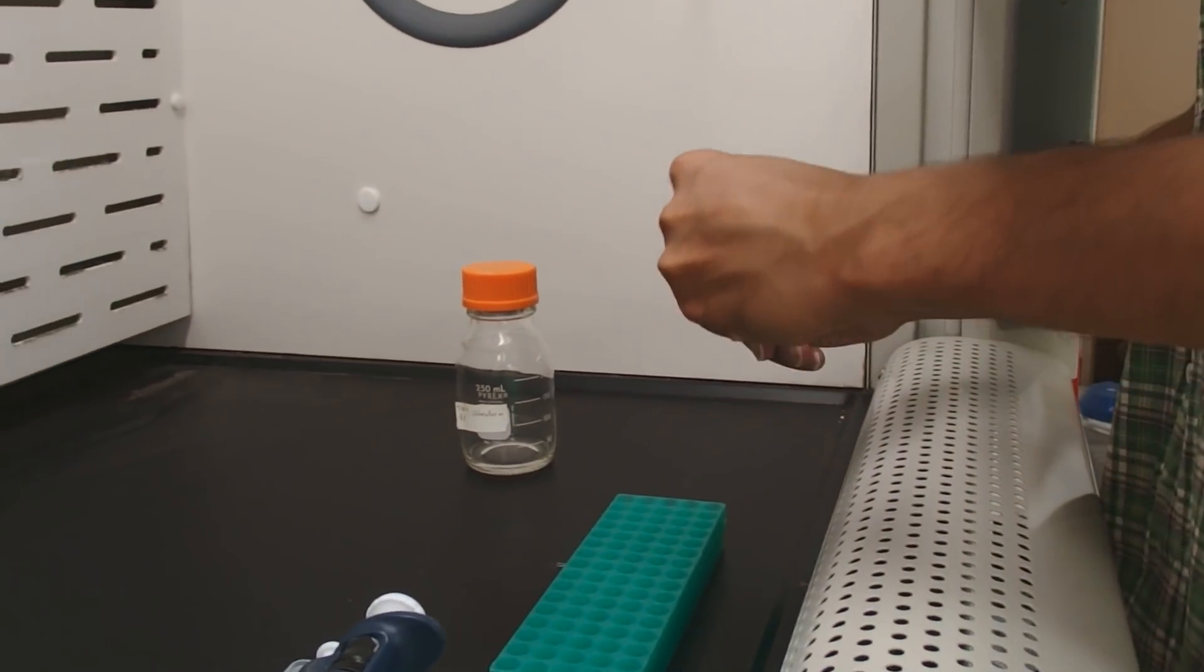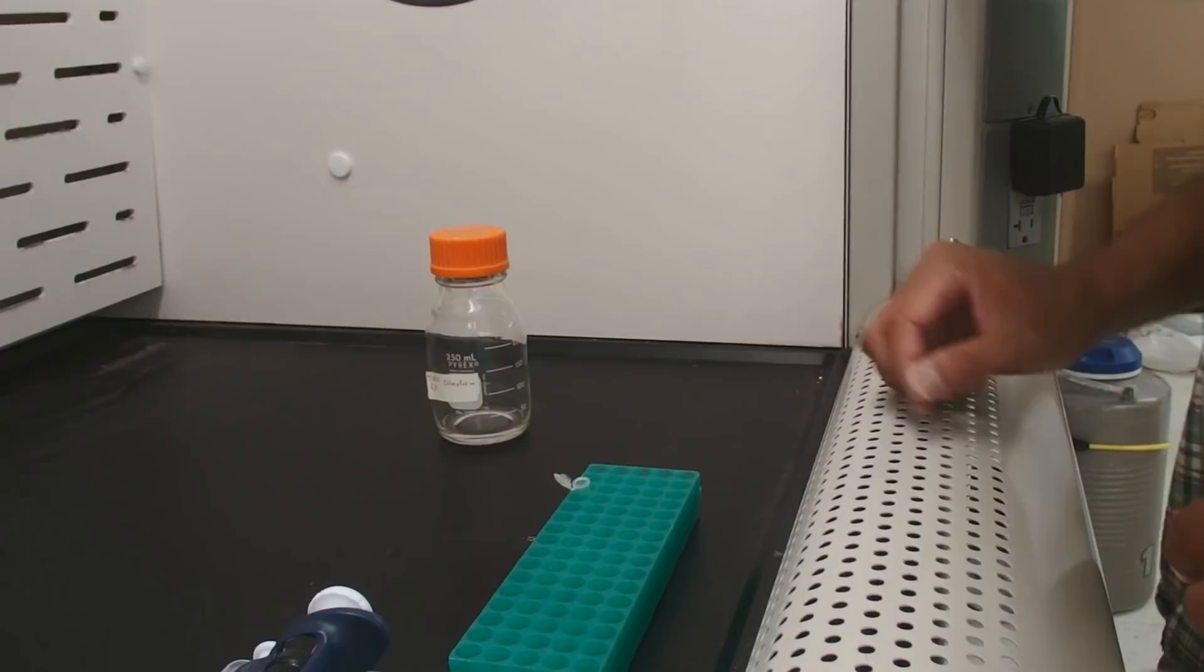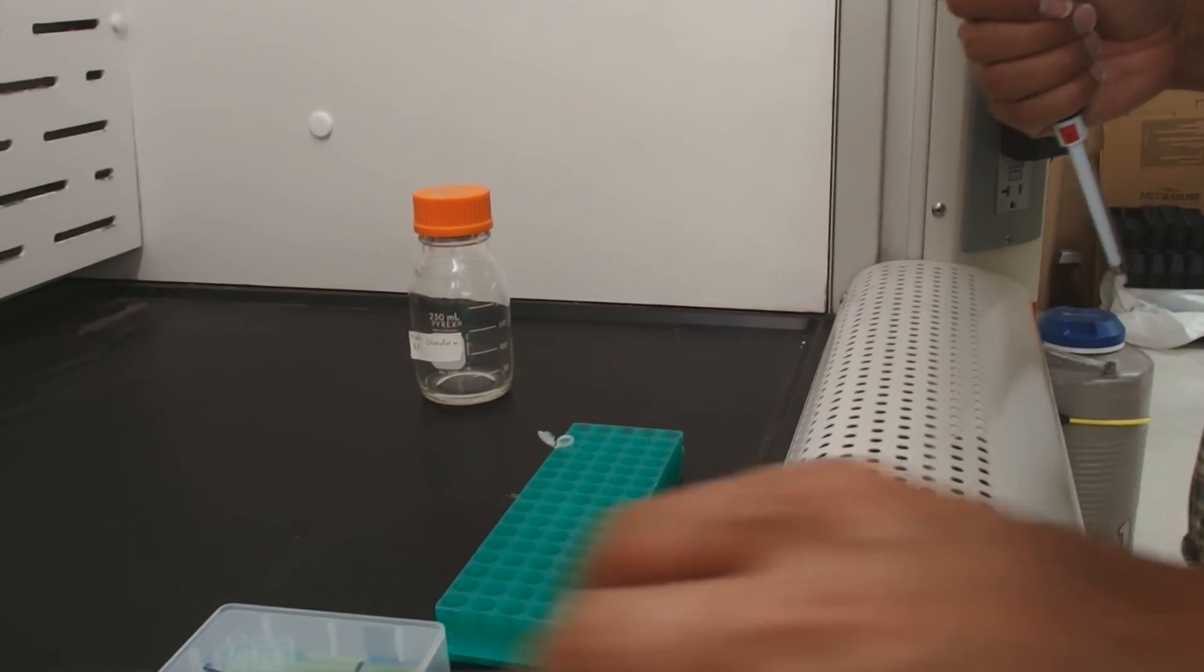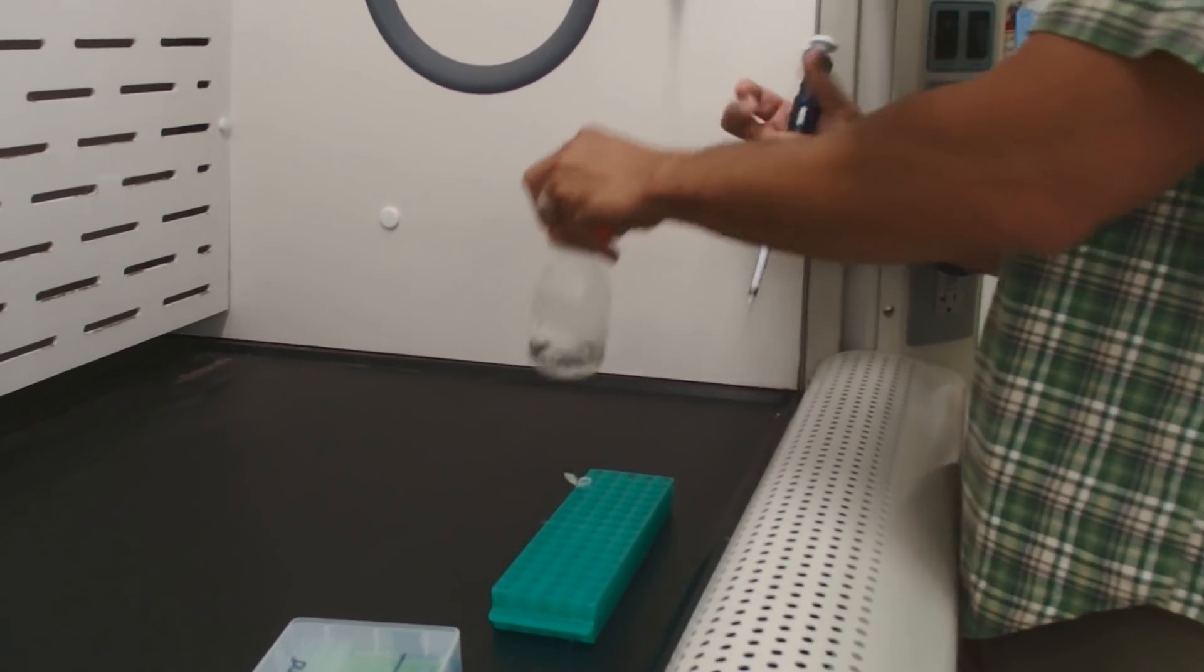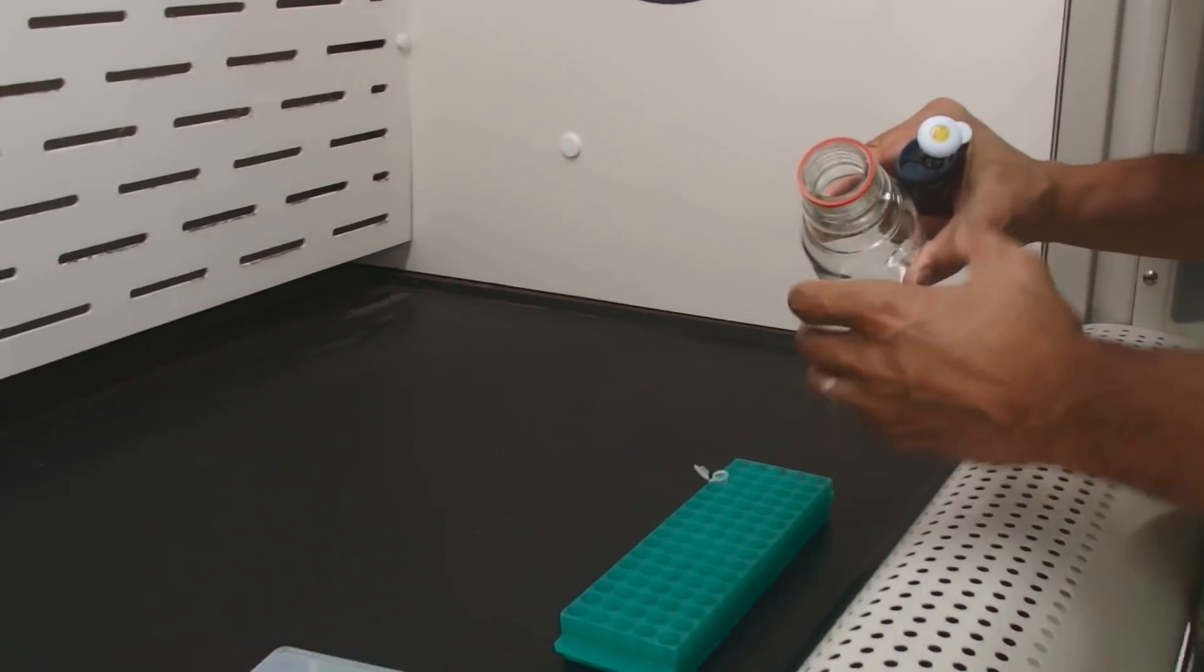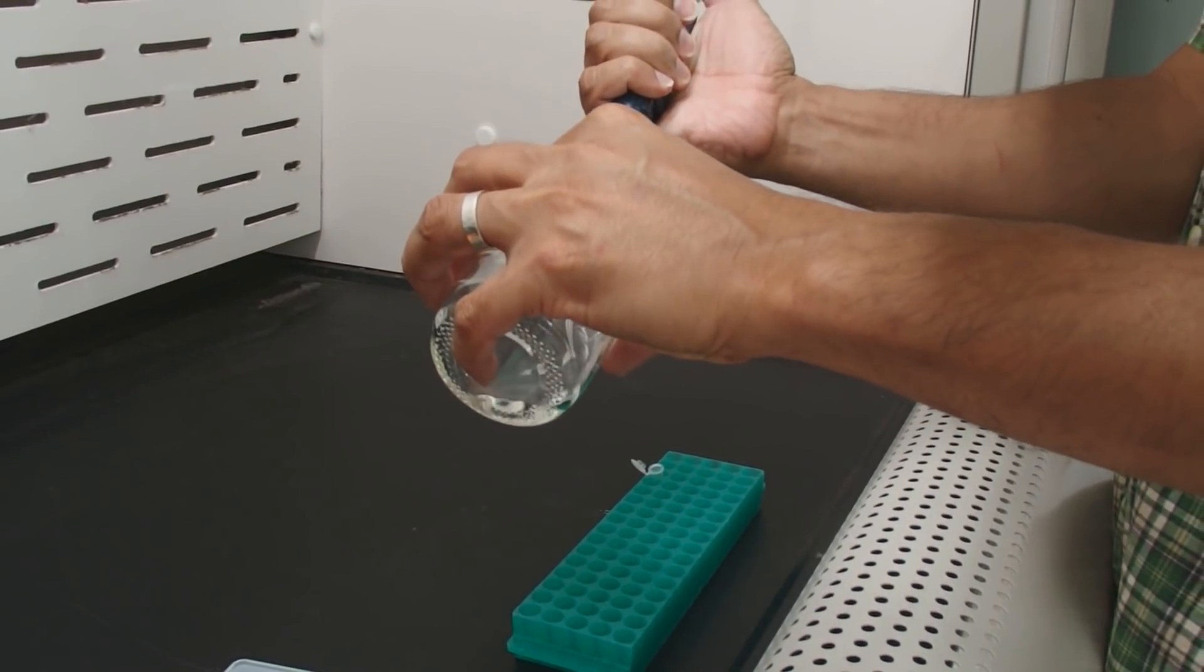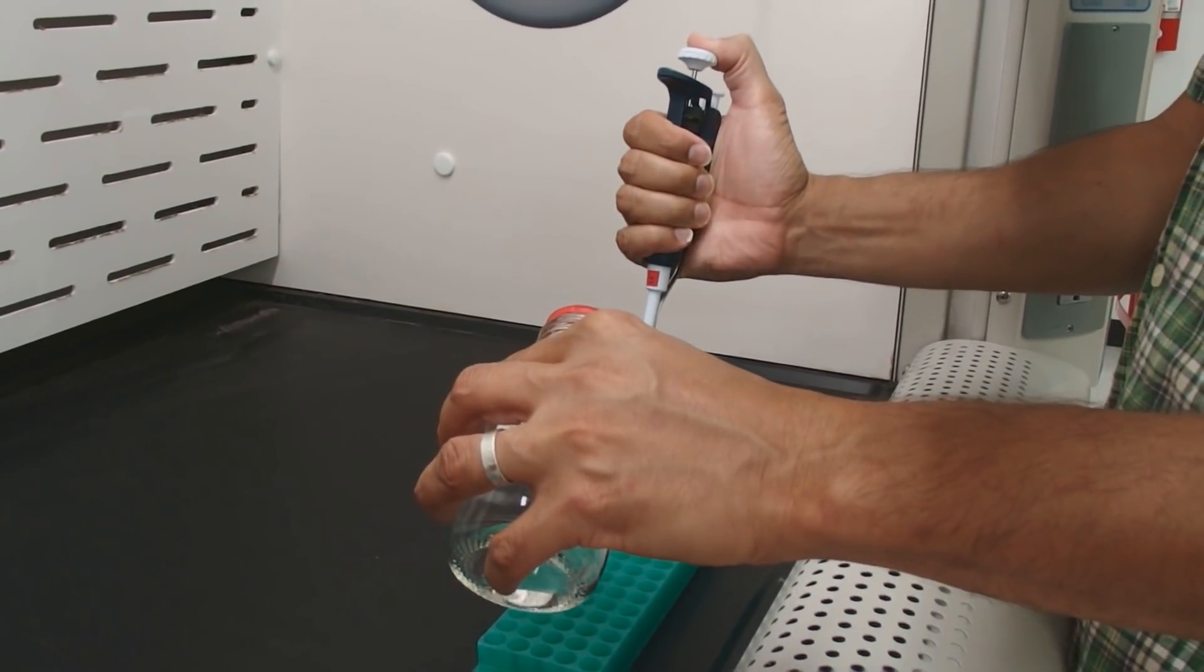So, that easy way to let that cool down is just open the lid and let it sit there for a moment. I could feel by my hands, it's not terribly hot because I'm using a fairly small volume. Definitely want to work with chloroform in the fume hood. It's carcinogenic. It can also make you pass out if you inhale too much of it.